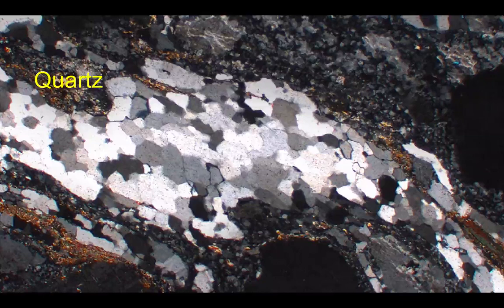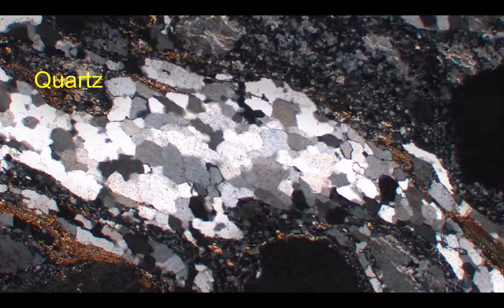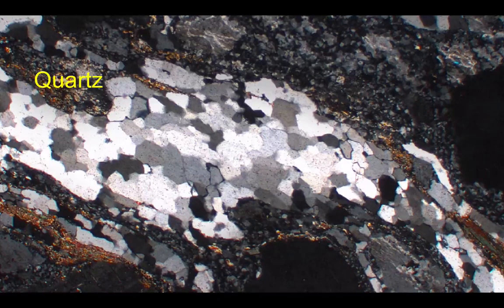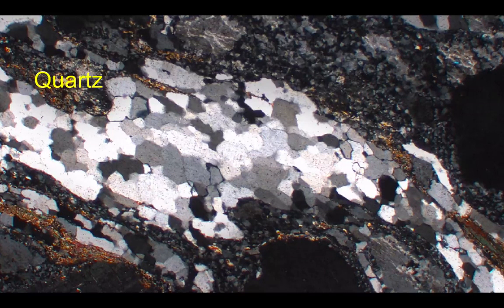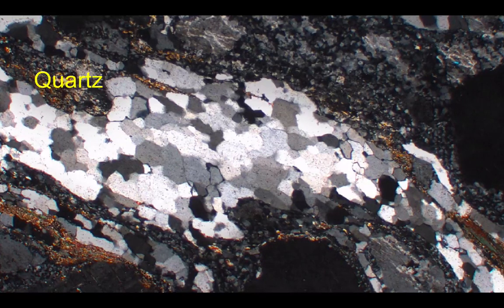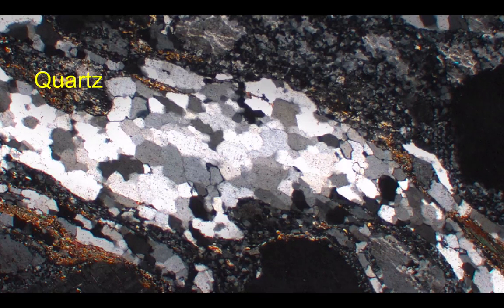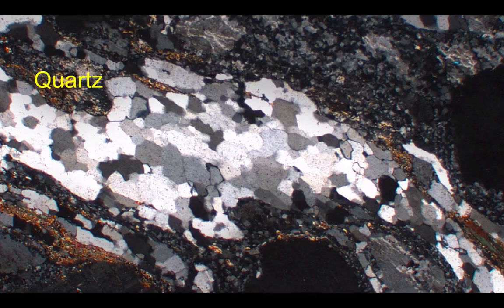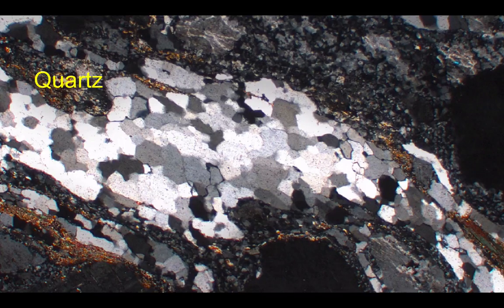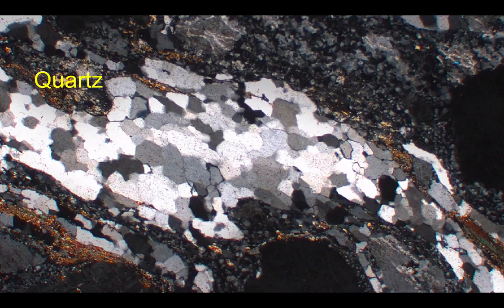One of these is obviously quartz. This is from a thin section of a metamorphic gneiss from Scotland. You can see that there's a band running through the middle of the view with a whole series of different crystals that range in colour from white through to black and lots of different shades of grey in between. This is distinctively quartz. If you look at it on the microscope and rotate the stage, as the quartz moves through different angles you'll see it changing from white to black and back to white again.